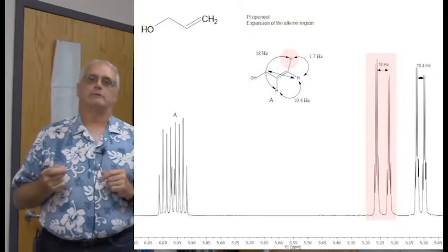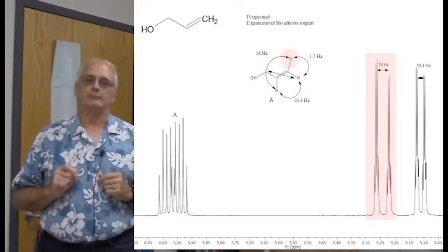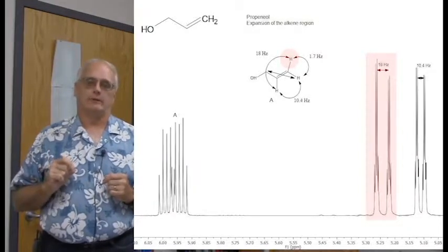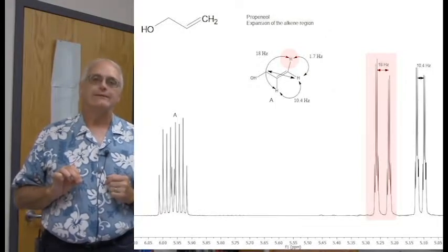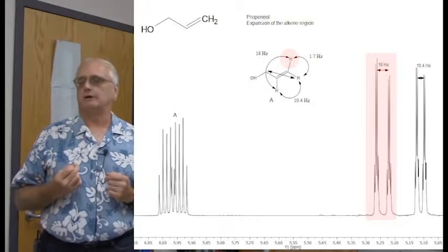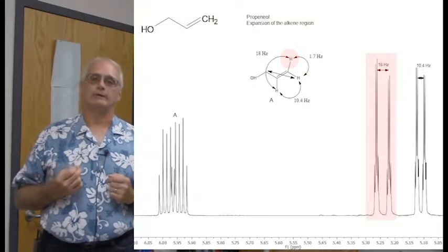And then a second doublet because of the geminal coupling to its neighbor, the cis proton on the same carbon, and then a long-range coupling back to the CH2 group through the double bond. And if the long-range coupling and the geminal coupling have roughly the same coupling constant, here around 1.7 Hertz, then you get this doublet. It should be a doublet of triplets, but if the two small coupling constants, the geminal and the long range, are equivalent, about 1.7 Hertz, then you're going to get a doublet of quartet appearance here.